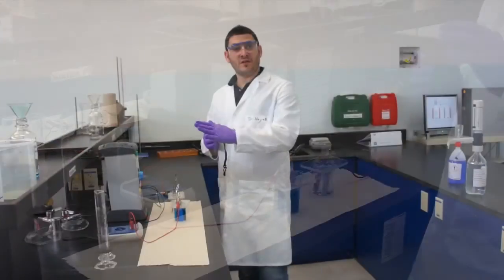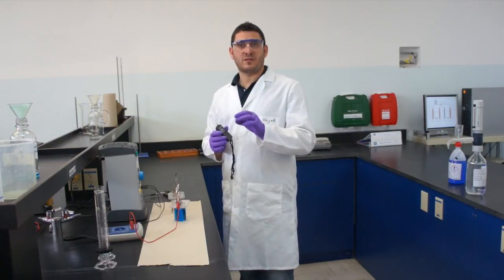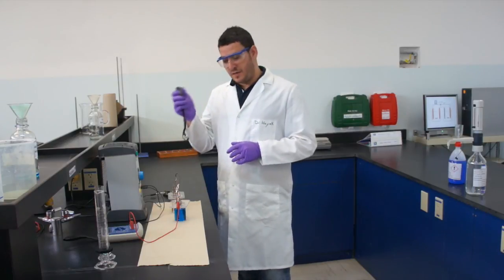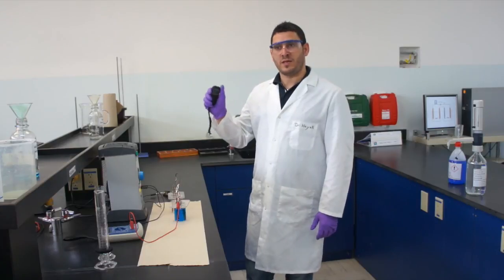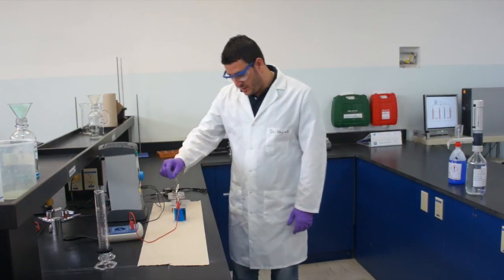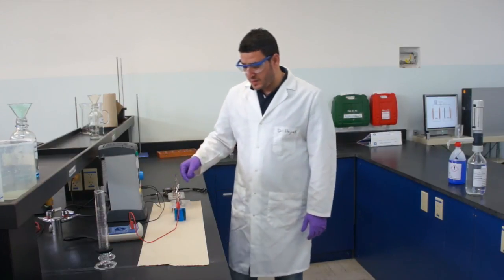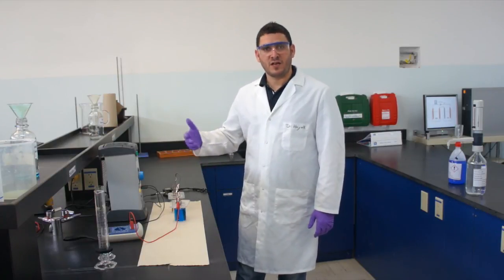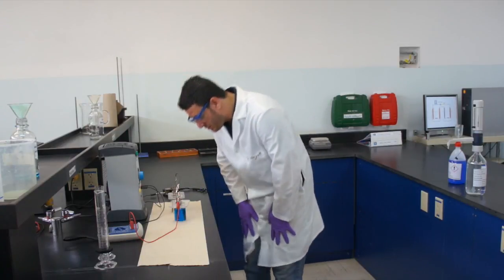Even if it's not exactly 0.7, you can still record that value and use it in your calculation. After running for 30 minutes you just wait, but while waiting you can watch and clearly see what's happening on the copper cathode — with time it gets the zinc color, which is silver, depositing on it.